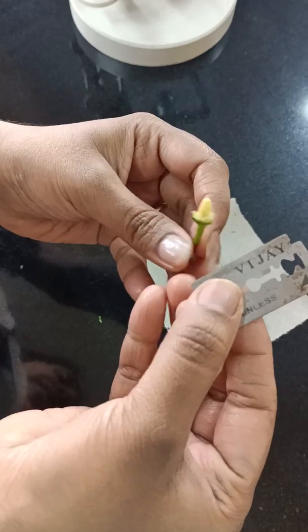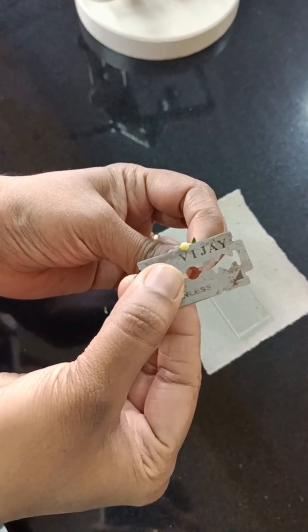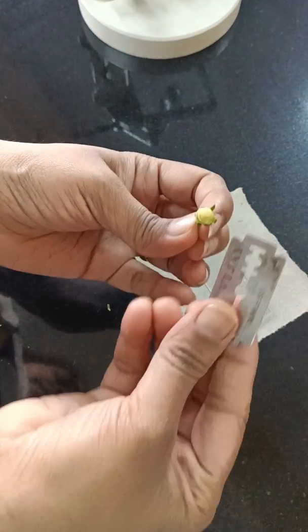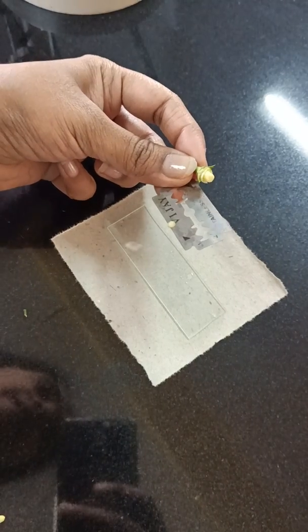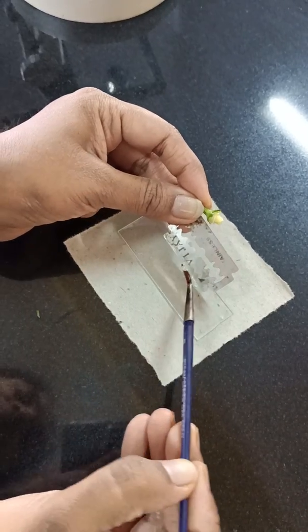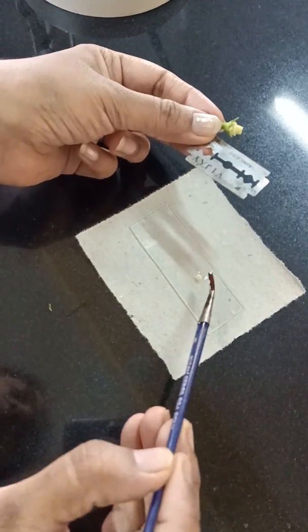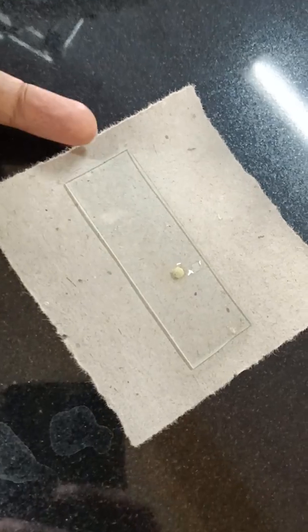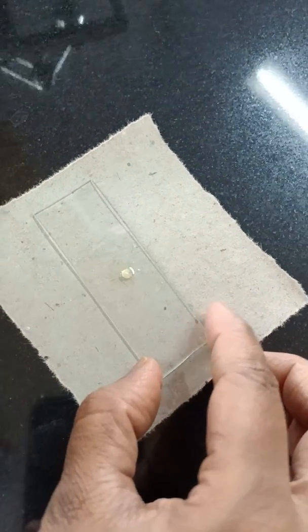After tracing the ovary, you need to cut off a small portion of it. Later you can take a thin section of this hibiscus ovary, mount it on the slide. The slide must have at least one or two drops of water on it. For this question you need to mount this particular slide using a simple microscope or dissection microscope — you are not supposed to use a compound microscope.